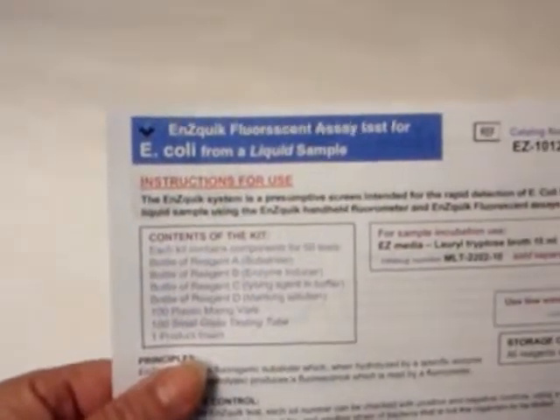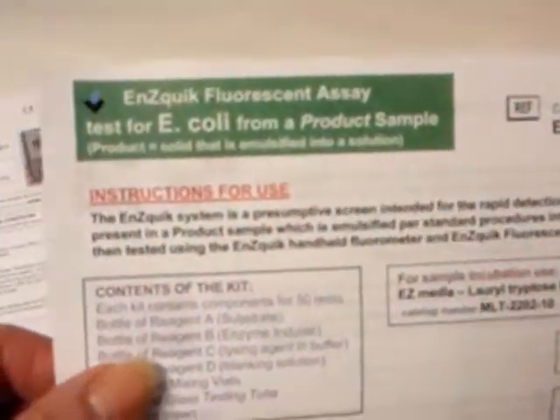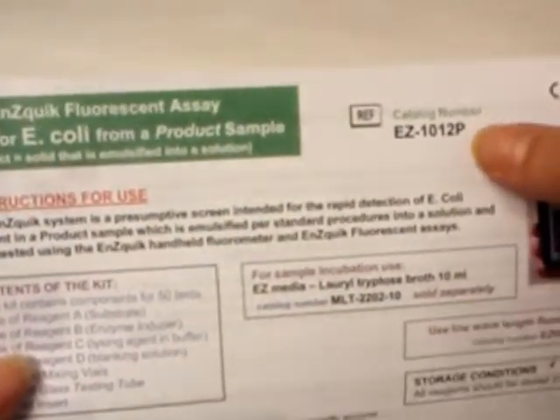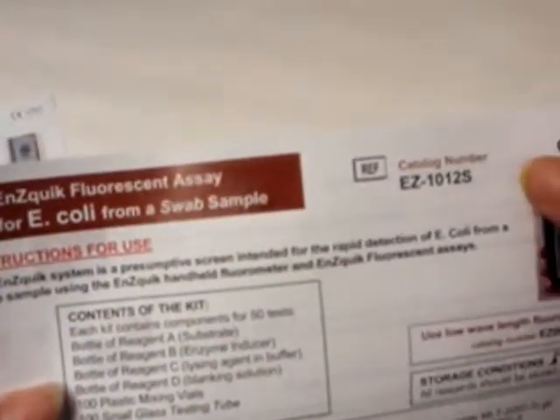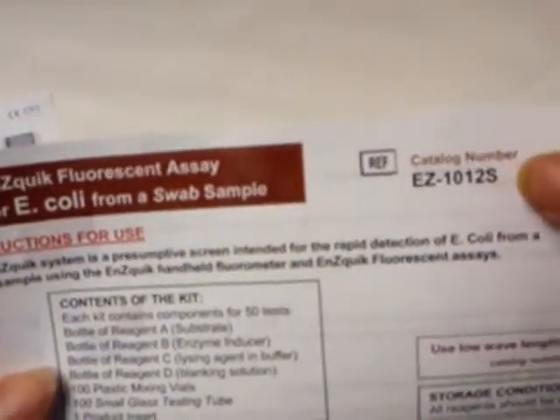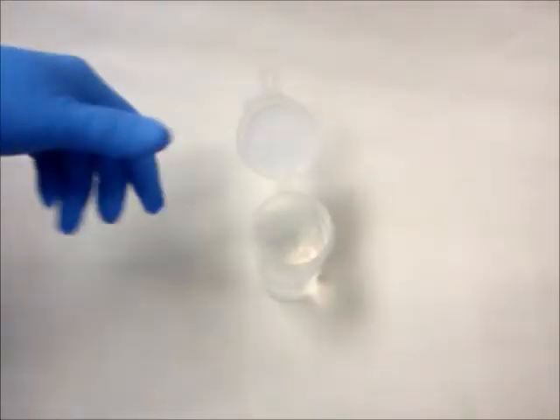Be sure to use the correct kit and product insert for the type of sample you will be testing. If you are testing water or other liquid samples, you will need to use the kit which contains the letter L for liquid in the product code. If you are testing samples such as food or cosmetics that need to be emulsified, then use the kit containing the letter P for product. If you are collecting a sample that requires a swab for collection, such as when testing surfaces, follow the product insert which contains an S for swab. For this demonstration, we will be using a liquid sample.